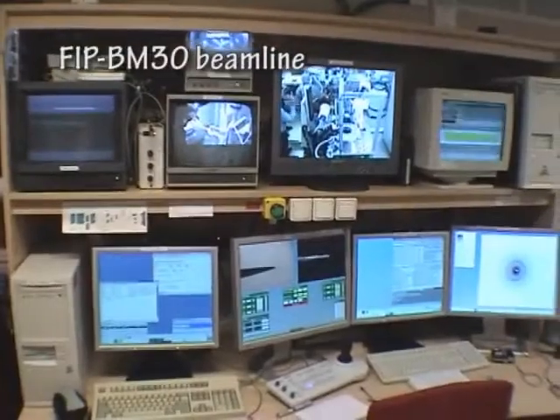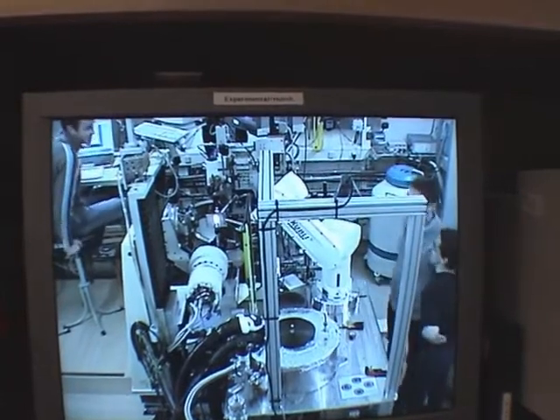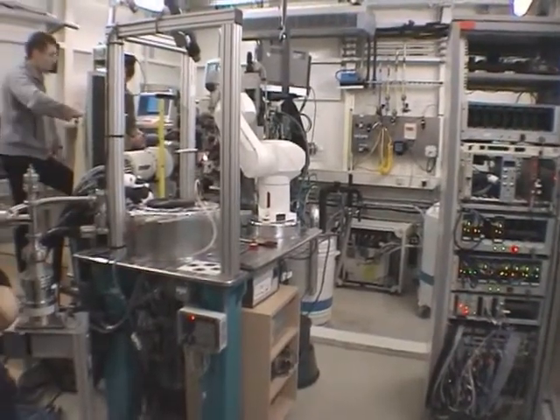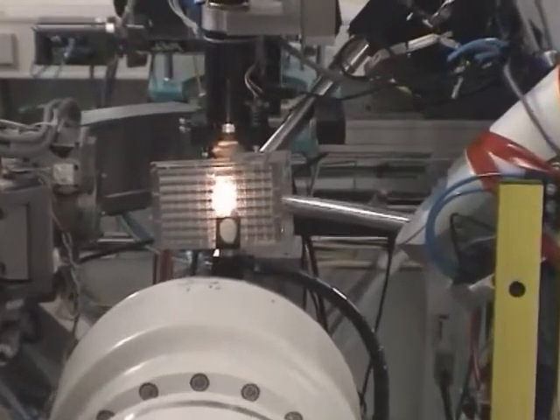These rays are collected and used in experimental hutches in different locations around the ring. Here is the control room of one of these areas. The sample is placed inside the hutch between the detector and the arriving X-ray beam.